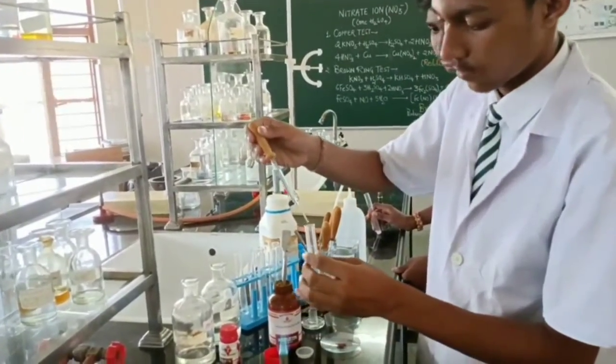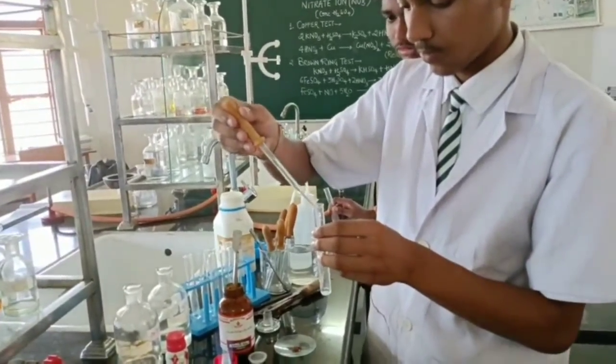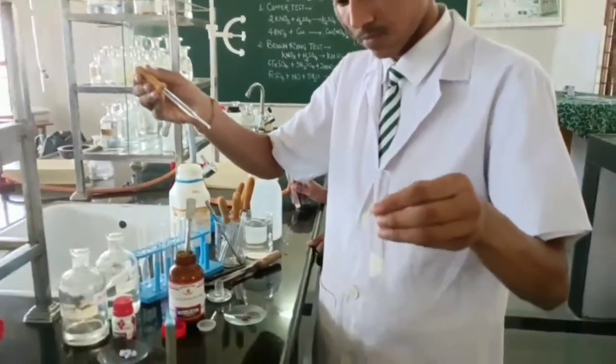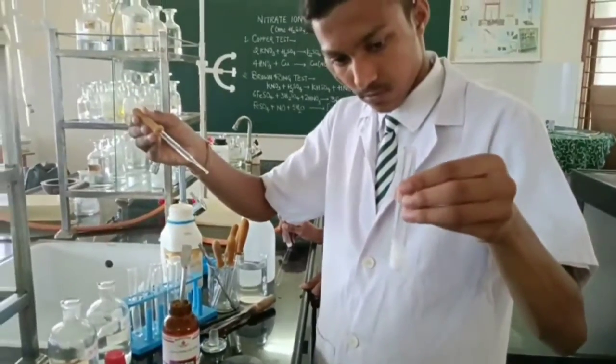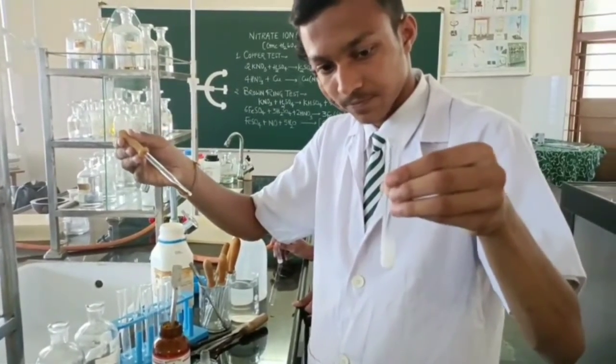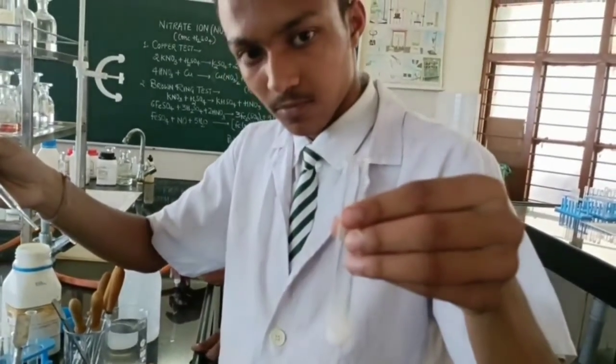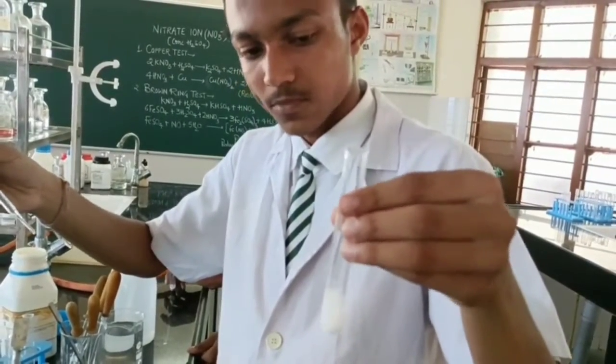Very good. Shake it. Can you see evolution of any gas or something? Yes, ma'am. Is it? That is the vapors of sulfuric acid you are able to see, beta.